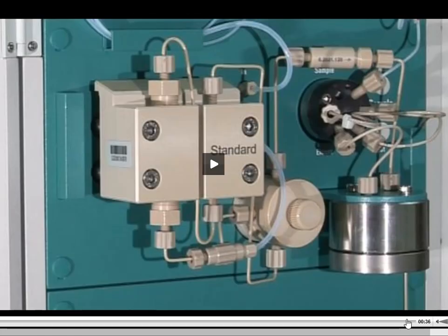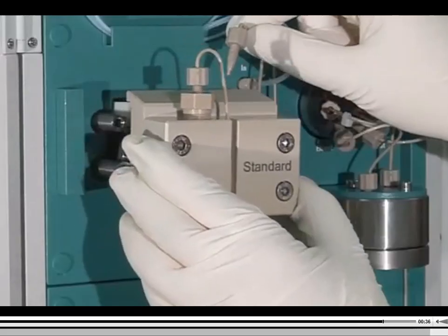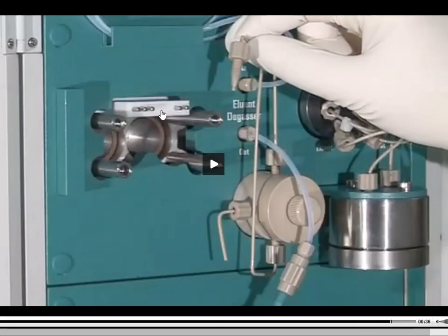I'm going to quickly pause it if I can do it fast enough. Look at this. All right. So on the inside, there's basically going to be an area that could get kind of crudded up and pretty nasty. So when you take this pump off, normally what happens is I'll take a chem wipe and spray it down with some alcohol, maybe methanol or isopropyl alcohol, and just give it a good wipe down on the inside of here. If this is getting all of your trash and all of the stuff that's coming along, then there is a chance that that trash and contamination, crud, can build up on the inside of this chamber. So just give it a quick wipe down, a quick rinse, no big deal there, but just keep the system clean. And that includes what your pistons and stuff are going into at that moment in time.